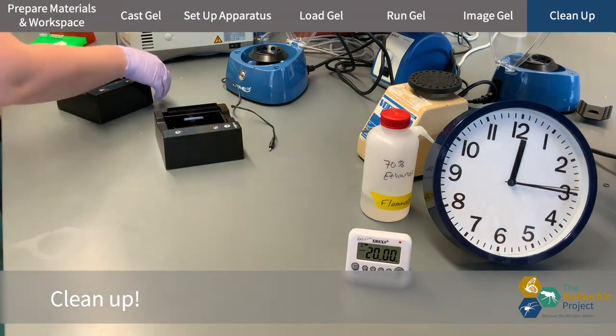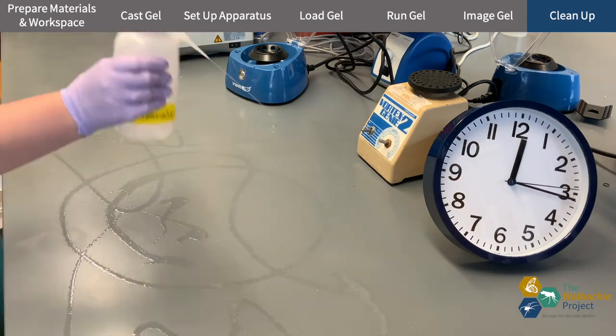I finish cleaning up my bench and then I'm able to upload my gel results to the Wolbachia project database.